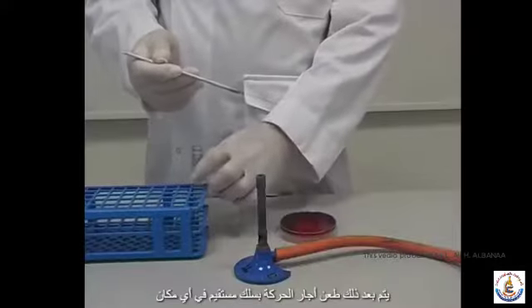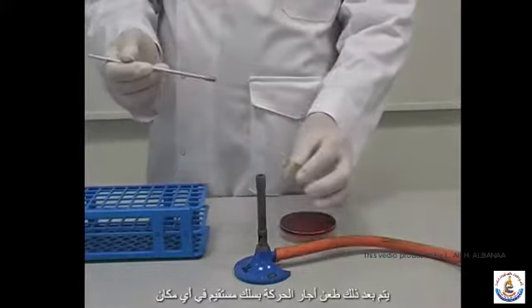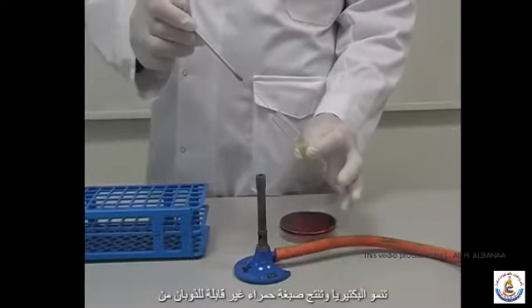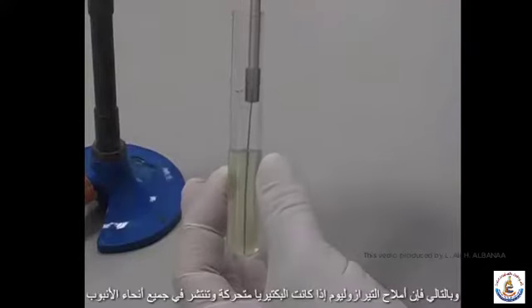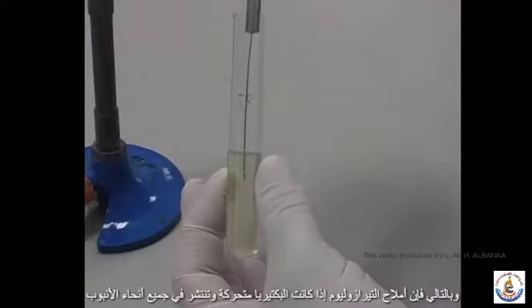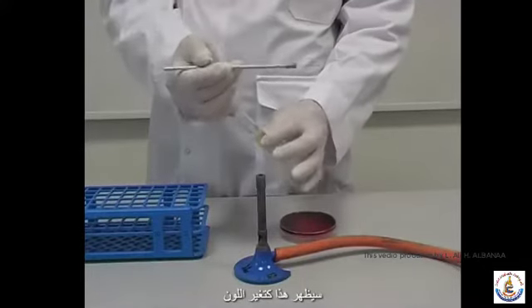Step 2. Stab inoculating the motility agar. The motility agar is then stab inoculated with a straight wire. Wherever the bacteria grow, they produce an insoluble red pigment from the tetrazolium salts. Thus, if bacteria are motile and spread throughout the tube, this will appear as a colour change.